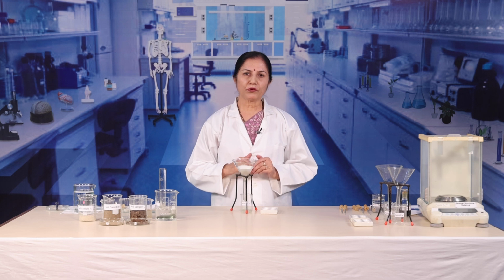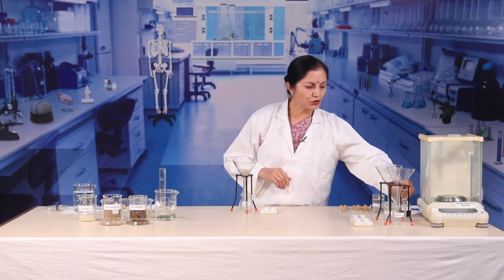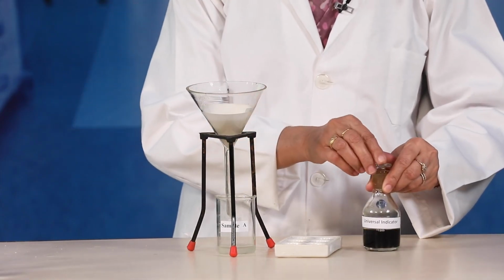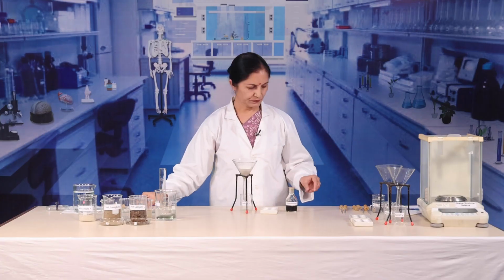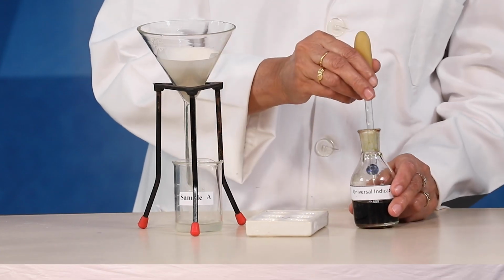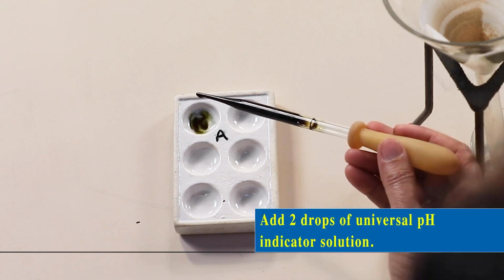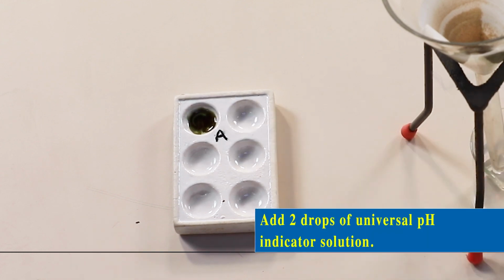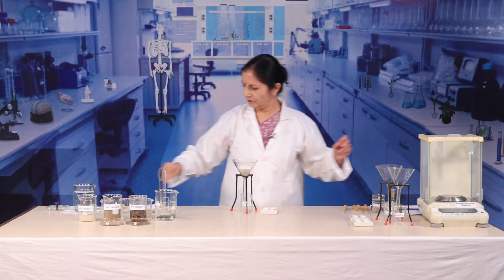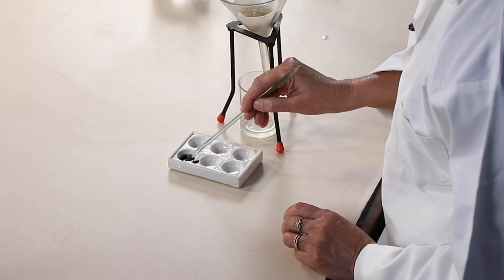To the 5 drops of soil solution present in one cavity, add 1 to 2 drops of universal pH indicator solution. Mix the contents.